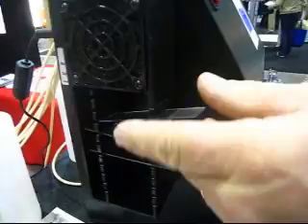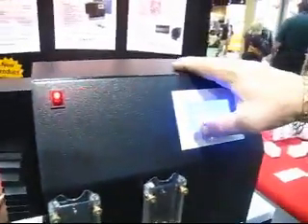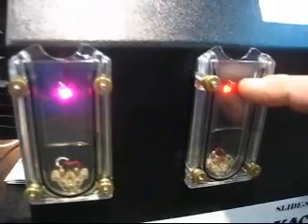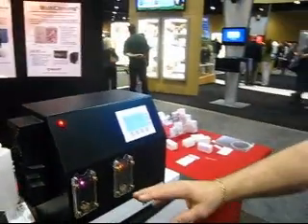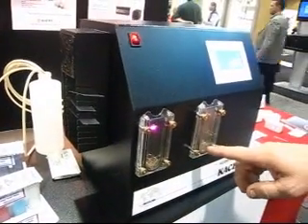We have a built-in dryer to dry the slides. When you press OK, the system will evacuate any waste material in the bottom of the cuvettes, then fill with the cleaning solution to the stop electrode. It will hold there while it washes out the cuvettes, then evacuate any carryover of cells that may have fallen off the slide into the waste chamber, and when complete, it will shut off.